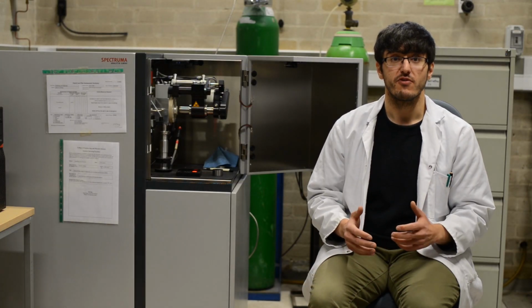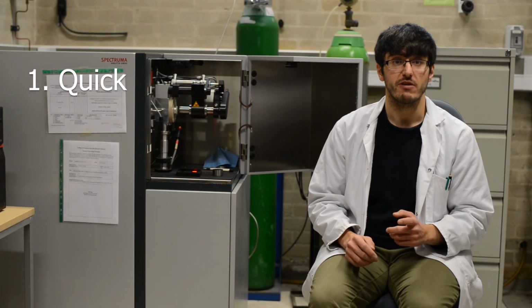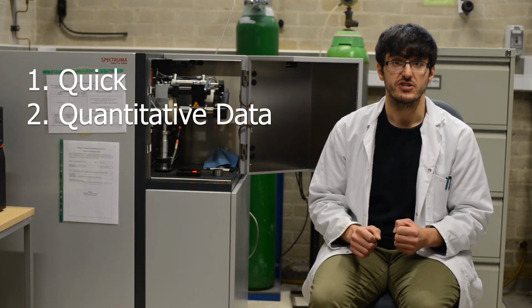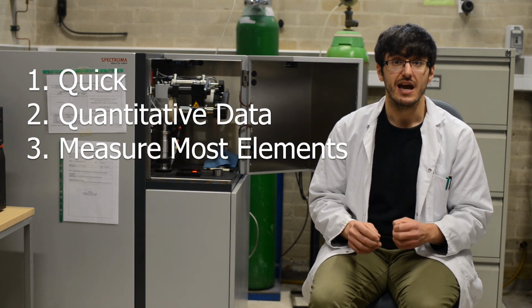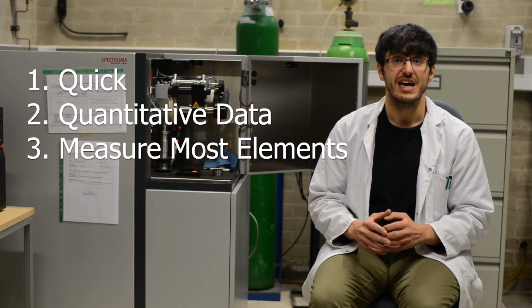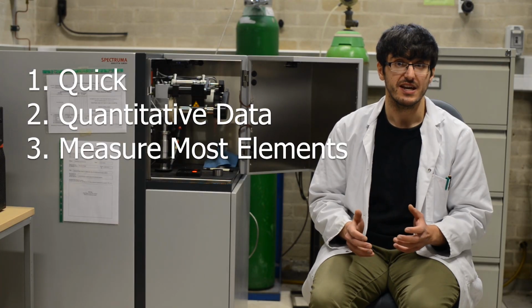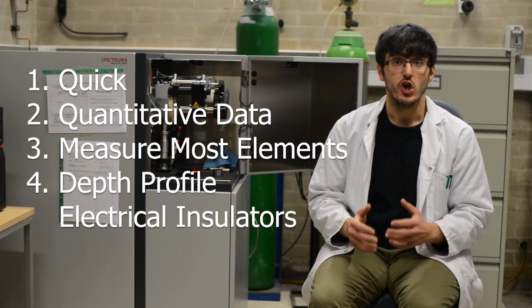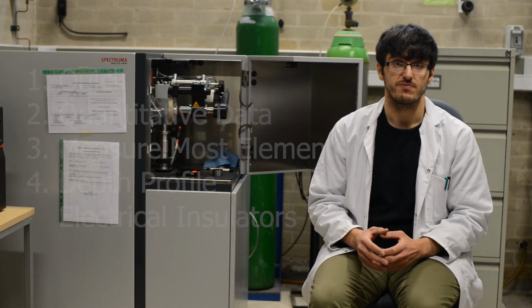GDS elemental depth profiling has many advantages, including 1, the ability to give very quick results within a few minutes, 2, the ability to give quantitative information, 3, the ability to measure most elements, including light elements such as nitrogen, which can be problematic for other techniques such as energy dispersive X-ray spectroscopy, otherwise known as EDS or EDX. And 4, the ability to depth profile non-conductive materials by changing from a DC source to an RF power source.